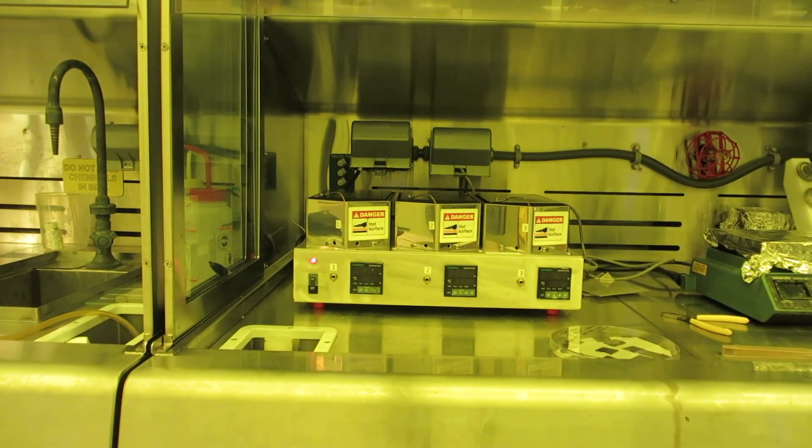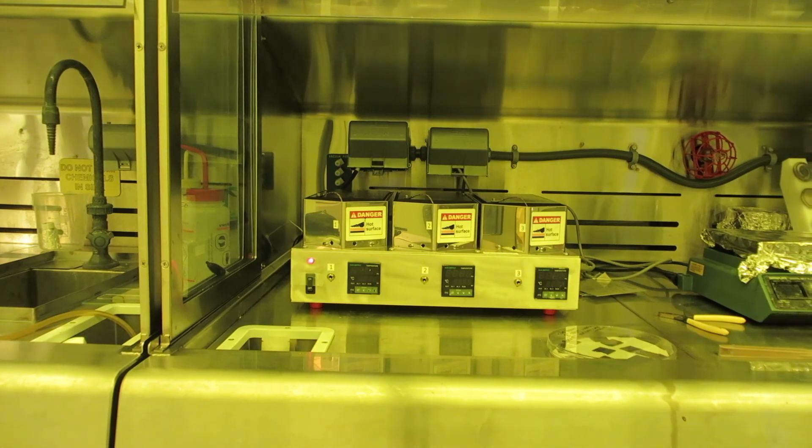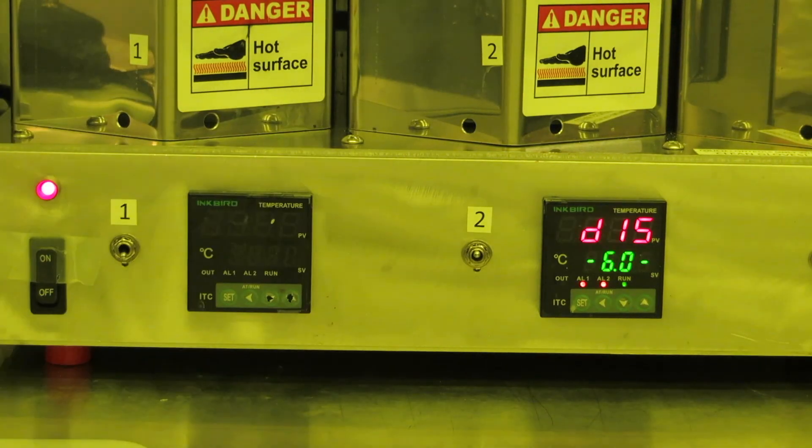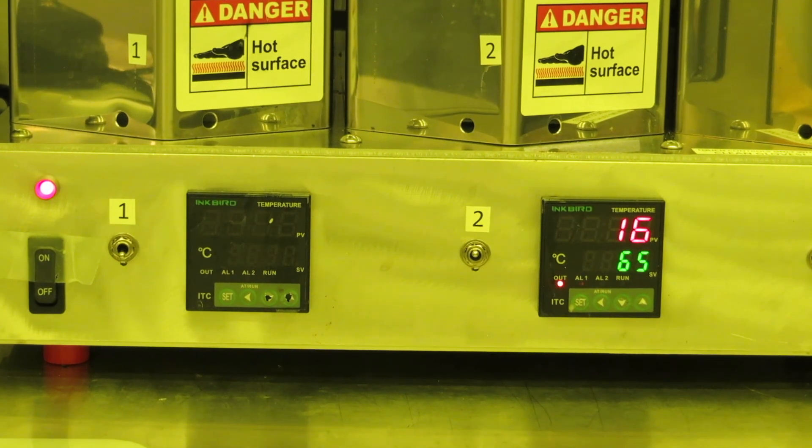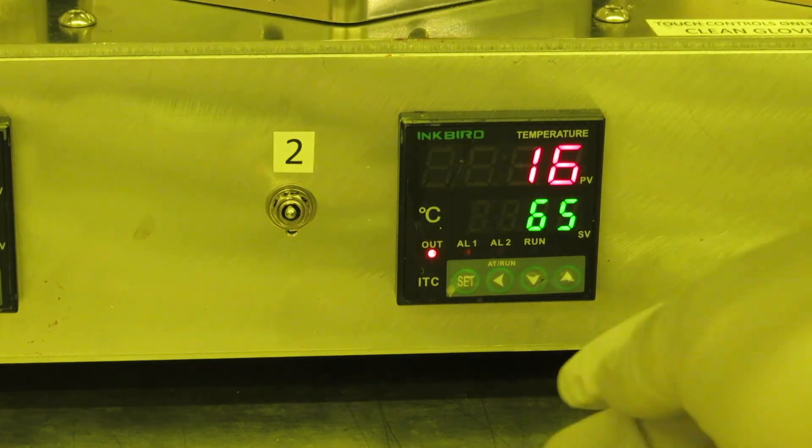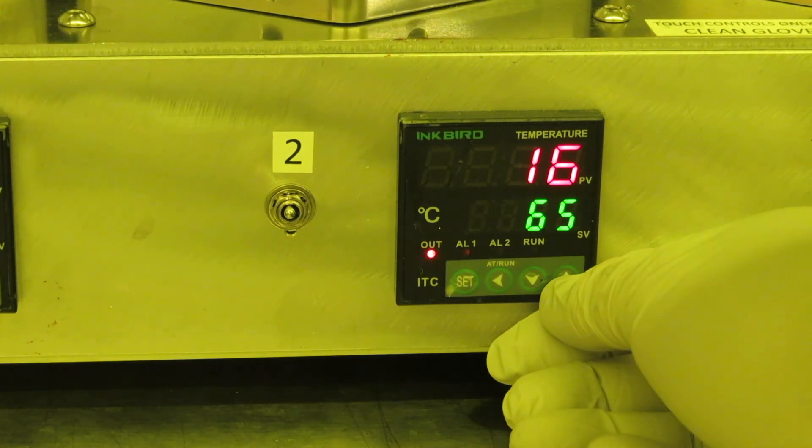A few seconds after you turn it on, you'll see some green numbers and red numbers. The red number is the actual temperature and the green number is the set point. We're going to use 95 degrees.